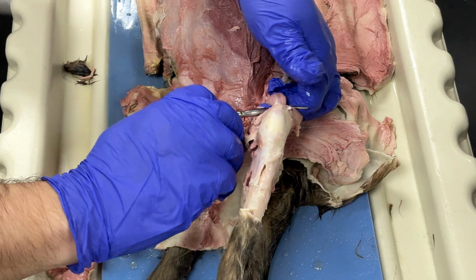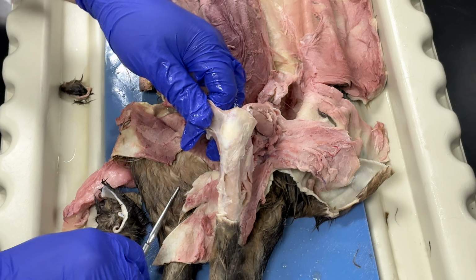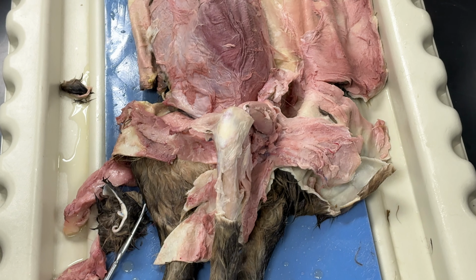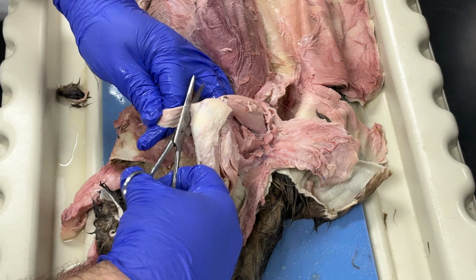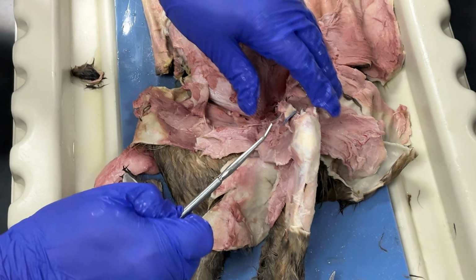And then I have, remember my gracilis, I'm gonna cut it from the knee, okay? So I'm gonna create like the flat, so these are blood vessels, right? So you see the blue, and they're dyed in latex. Okay, so we were in my vastus lateralis.